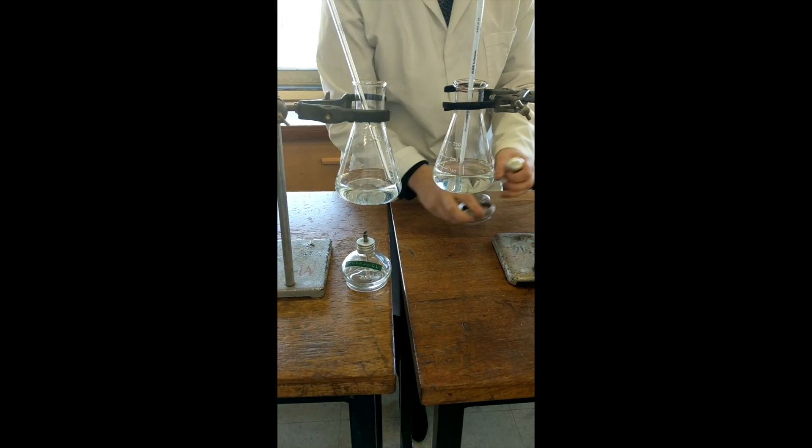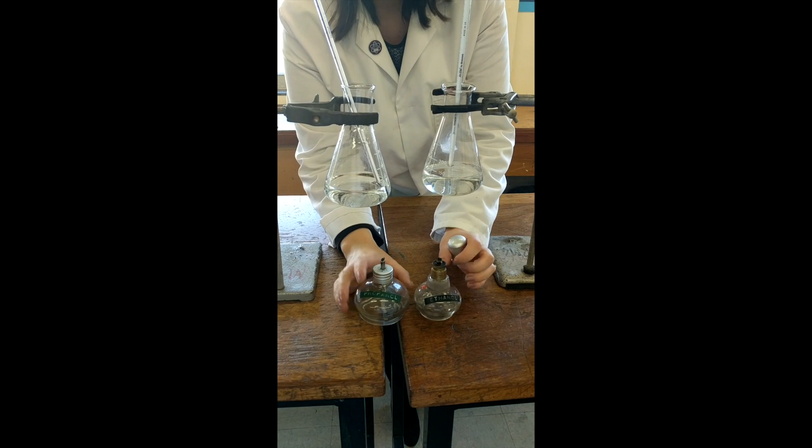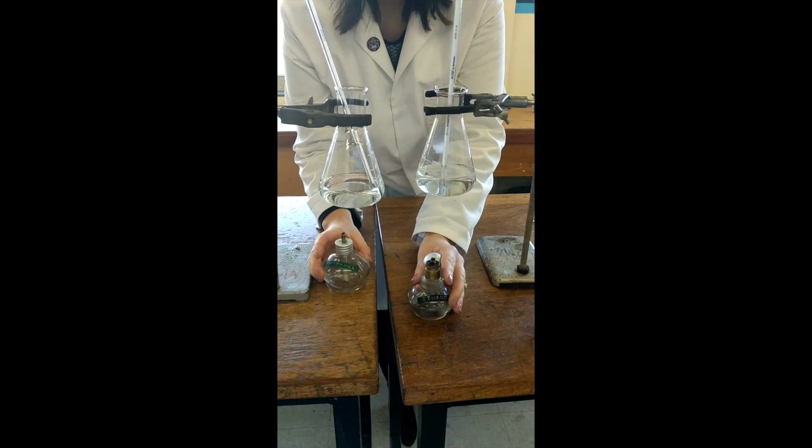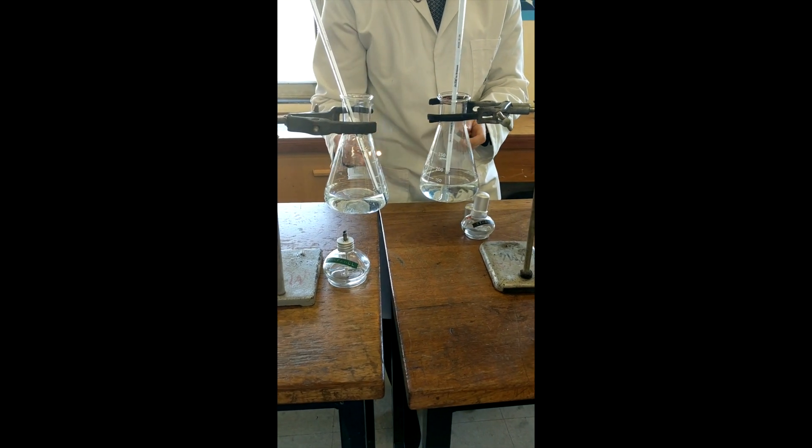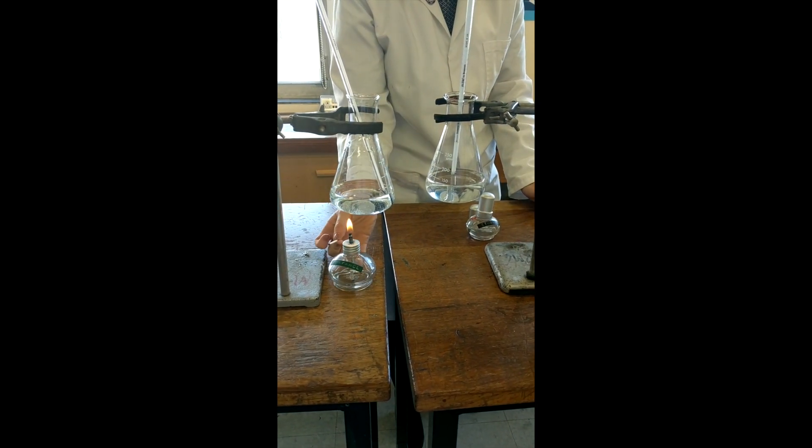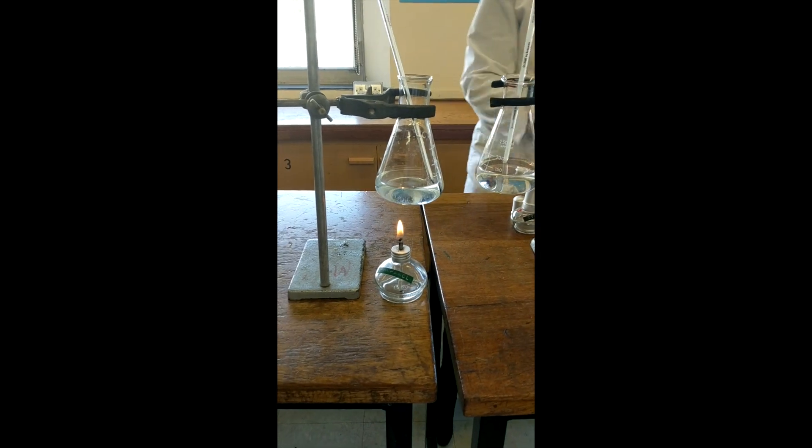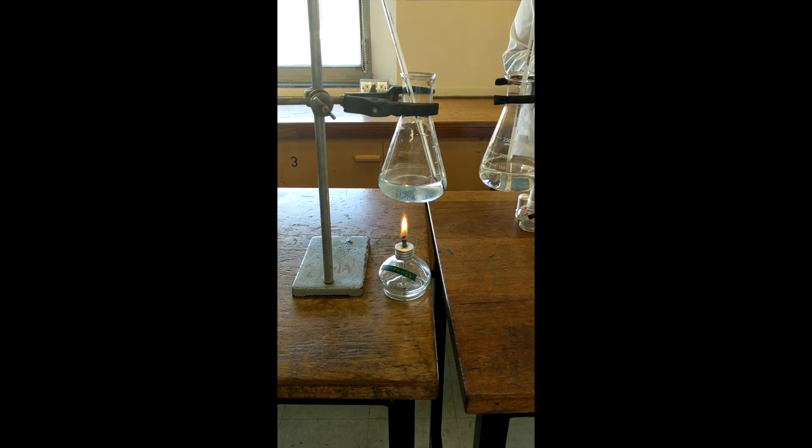You would then take it over. We've already checked the height of these being the same. We've already checked that we've got 100 centimeter cubed. And actually, if you look at the two sides of the wicks, they're of a similar height. There's not one that is longer than the other. So again, you can set fire to this one and let that heat up the water.